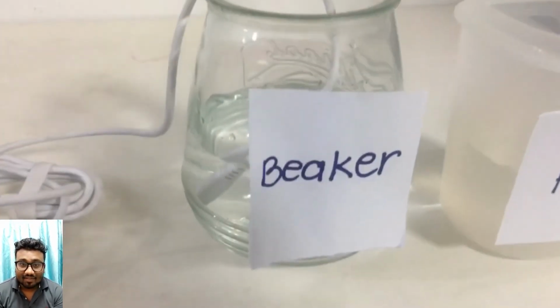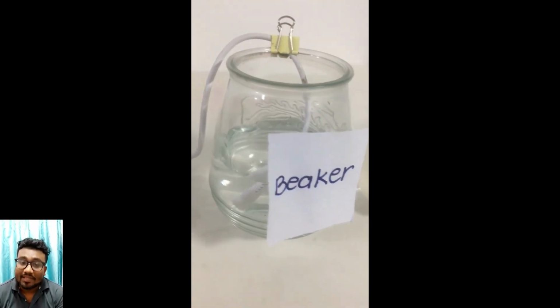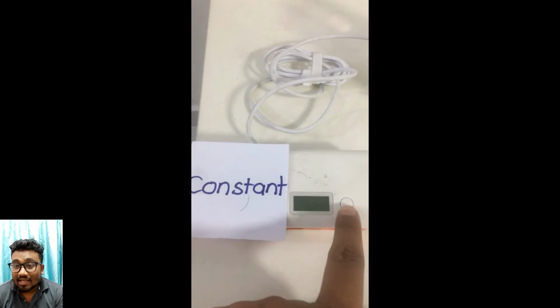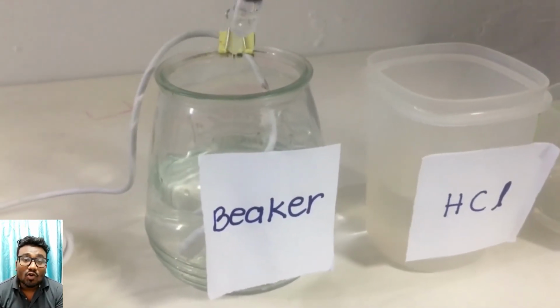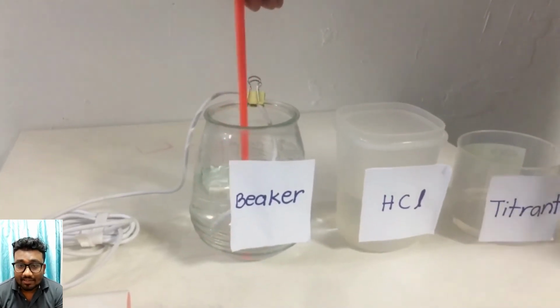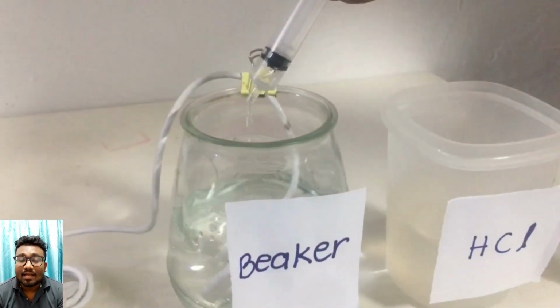Alkalinity test. First, prepare the 100 ml sample in the beaker. Secondly, dip the pH electrode into the beaker. Third step is to stir the sample with a magnetic stirrer. For this, press the measure on the pH meter and wait until the reading is stabilized. The next is to record the reading into the lab sheet. Following is to add 0.2 ml hydrochloric acid into the sample beaker and read the pH meter reading. Finally, repeat the step until a certain point and record in the lab sheet.